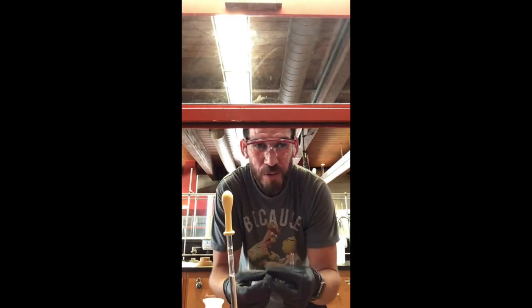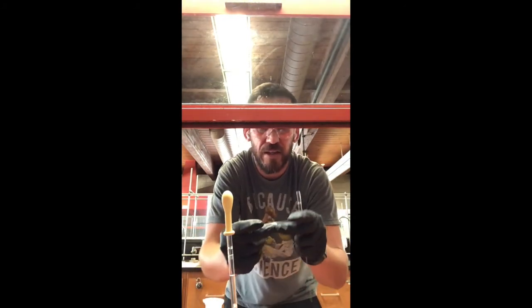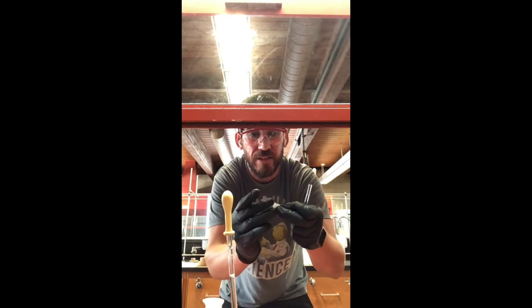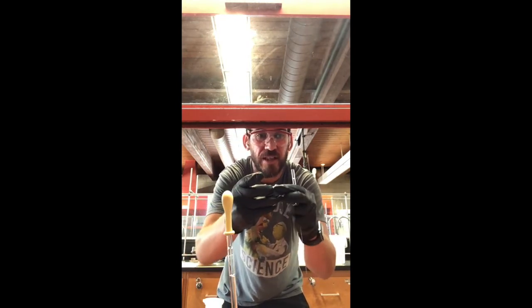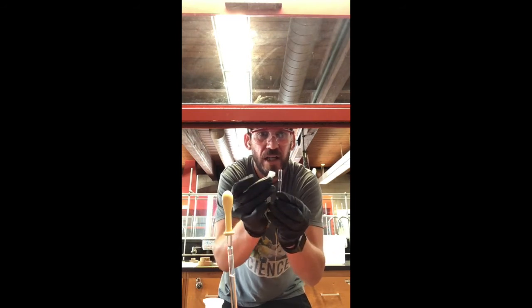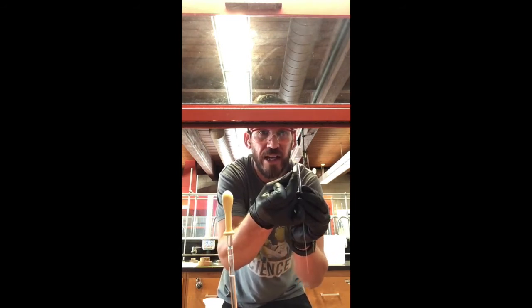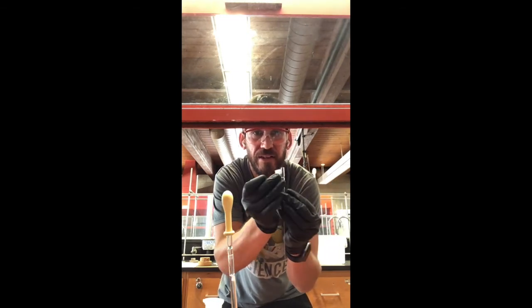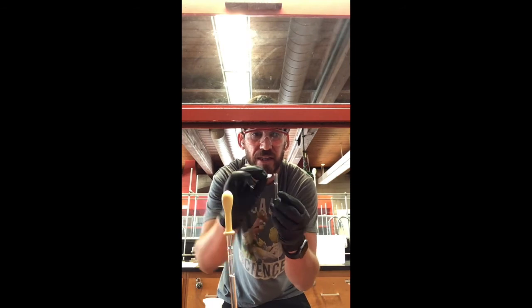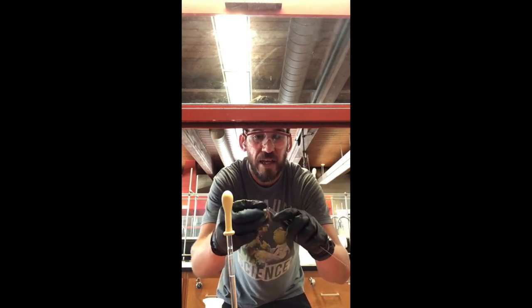So what we've got here, check it out, a pipette. Hey, look at this, a little cotton. So what we want to do is place that inside of the top, just a little bit. I'll give you a reference point. It's really thin, right? And the height of it is the size of the tip or this little portion right here that's kind of segmented, kind of like a worm.